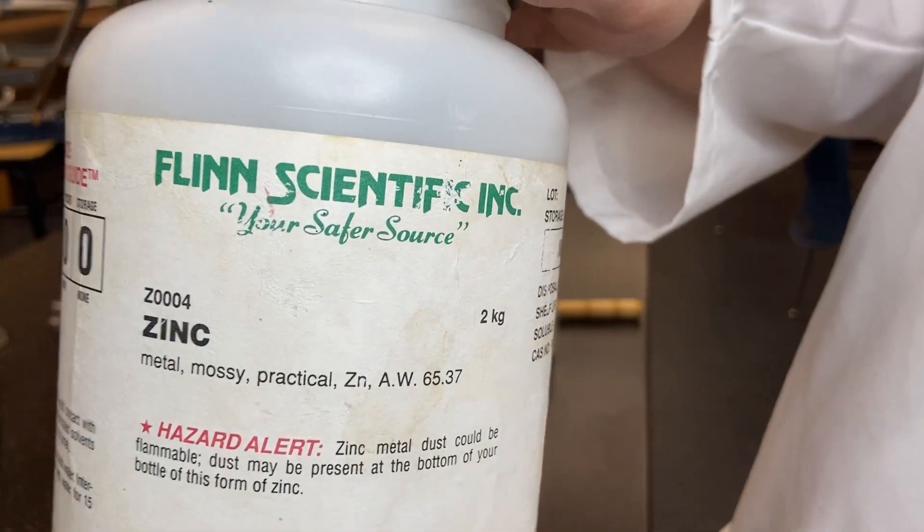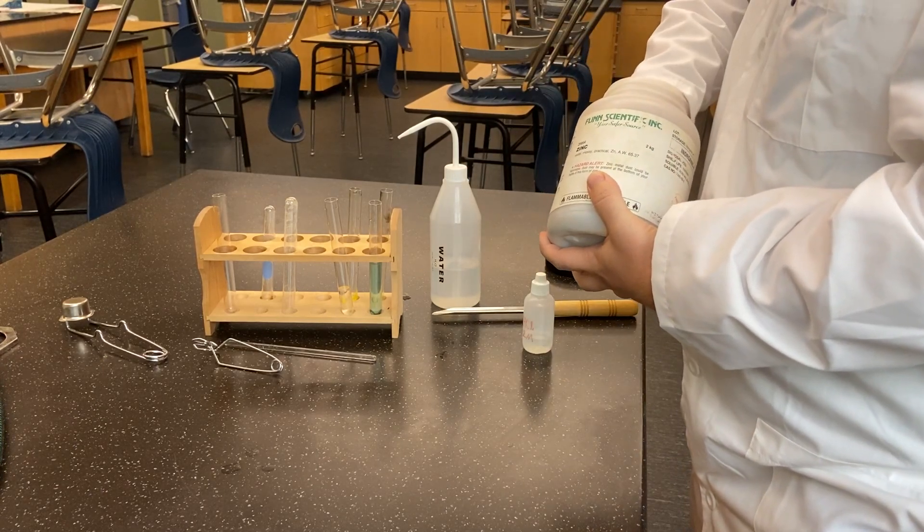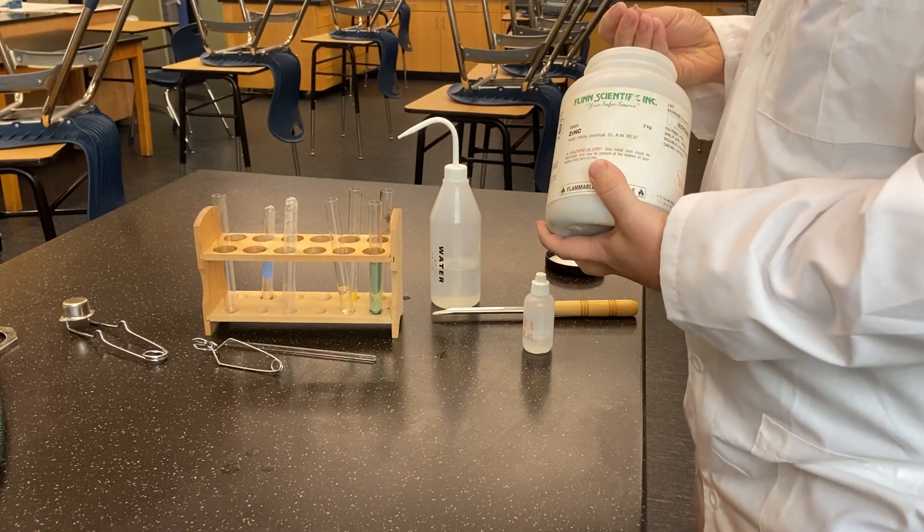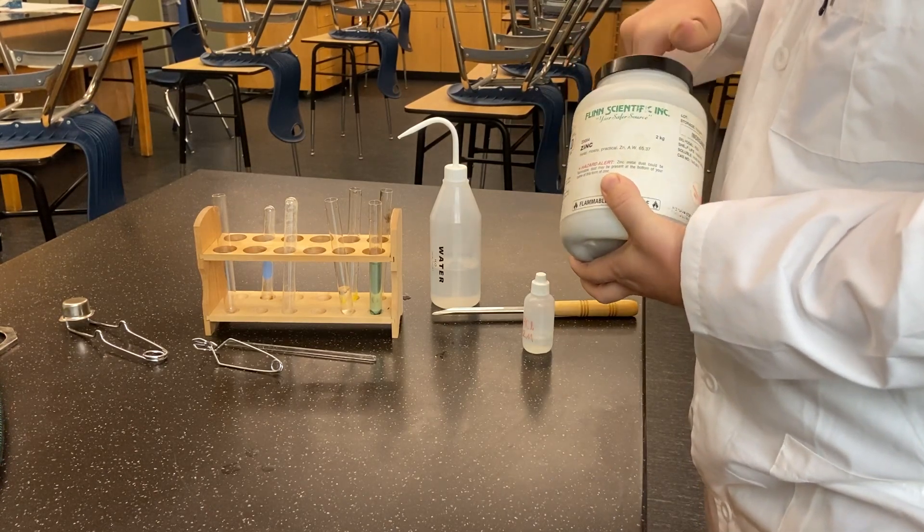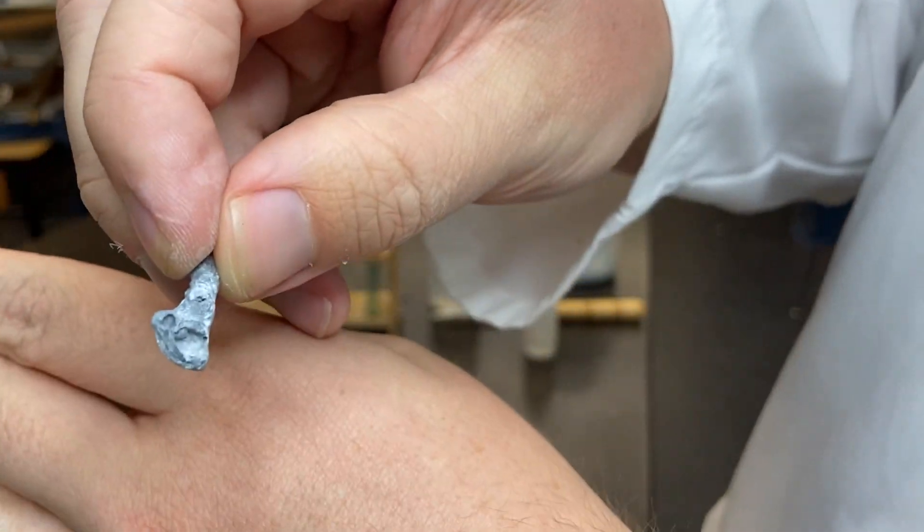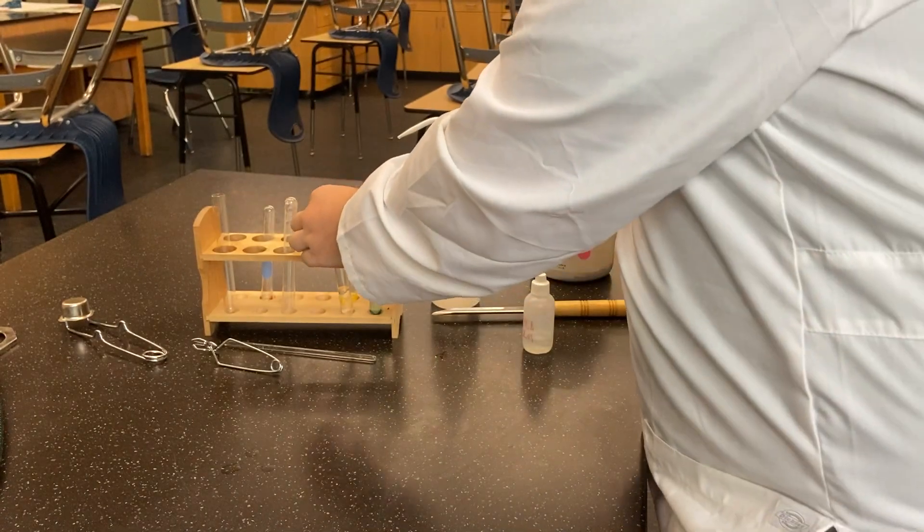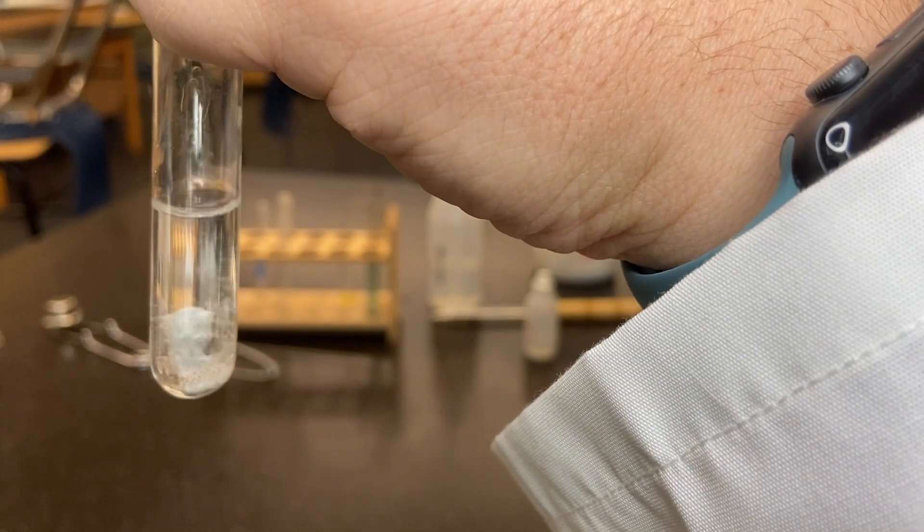And to that hydrochloric acid, we're going to add a single piece of zinc. Drop the zinc in the hydrochloric acid.